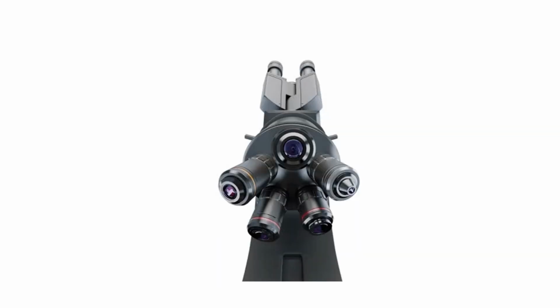So one more tip during the exam is that when you focus, you all know that you have to study hematology at 100x. It doesn't mean that you have to just start with 100x, because as you can see the size of the aperture of these lenses, this is 100x. Can you see how small the lens is when compared to other areas? The scanner usually has the biggest aperture, whereas the 100x has the least aperture. So the more power the lens has, the lesser the aperture.